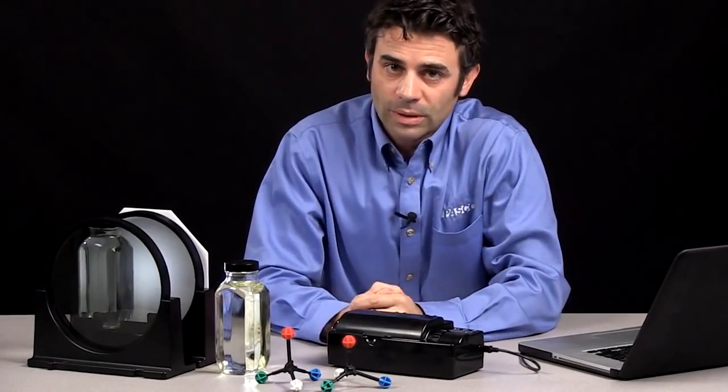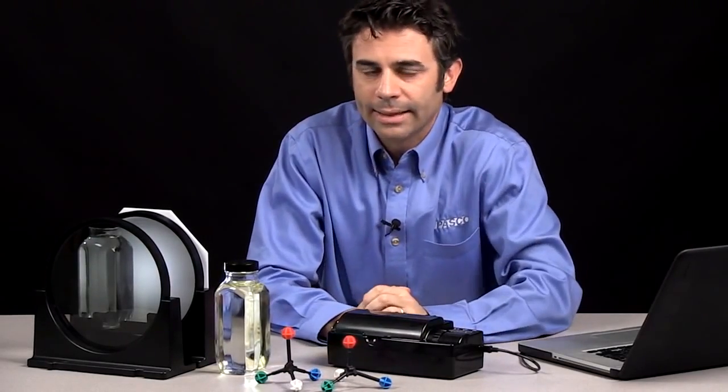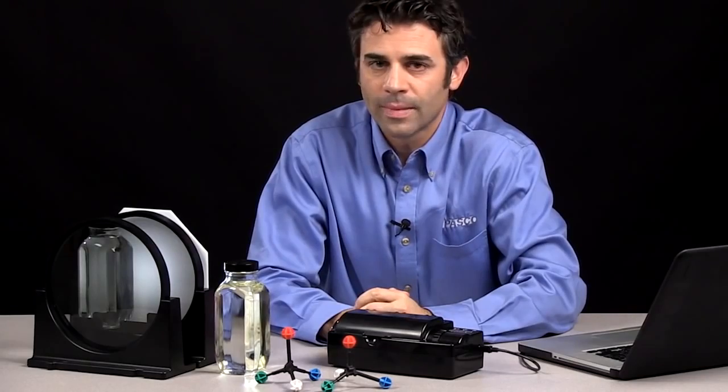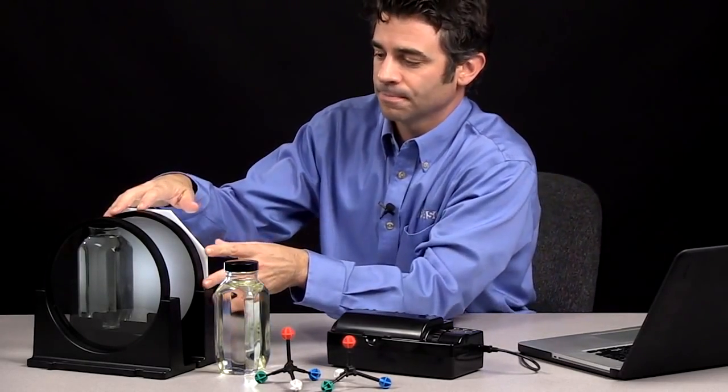These are called enantiomers, and these 2 enantiomers happen to have a chiral center, and that chiral center will rotate the plane polarized light either this way or this way, depending on the compound. So what does that mean, plane polarized light? Well, I can demonstrate that over here.